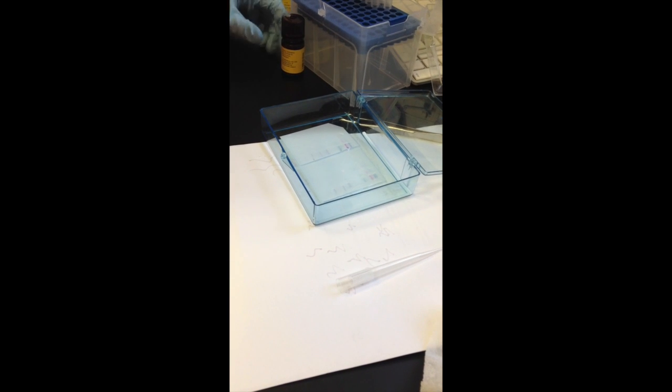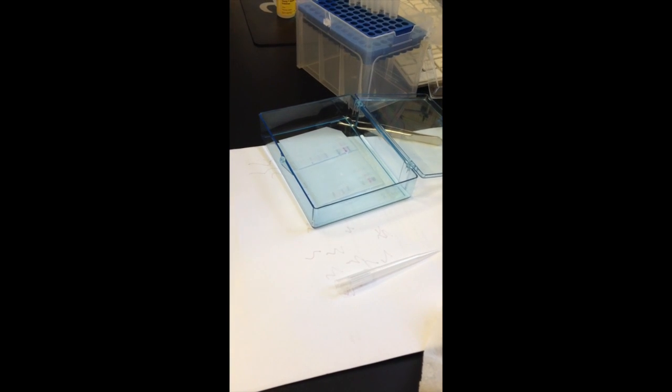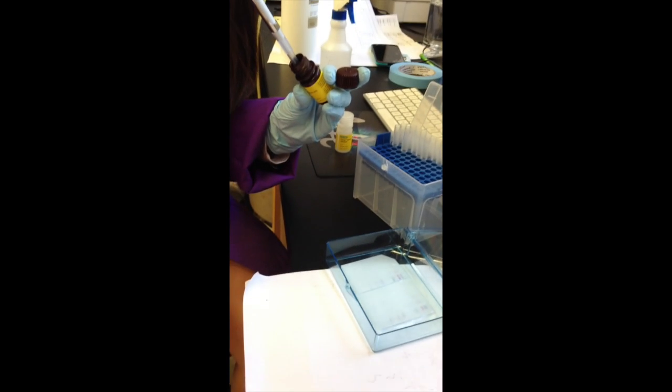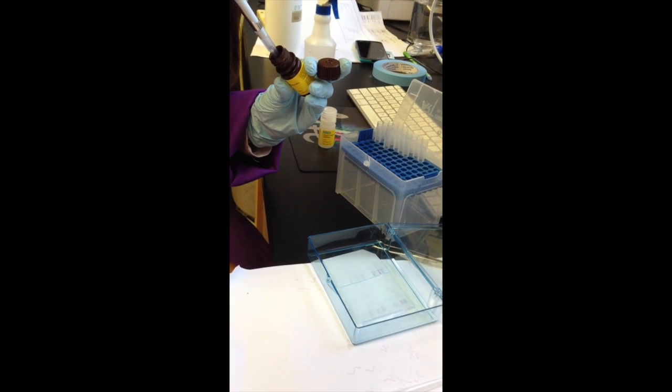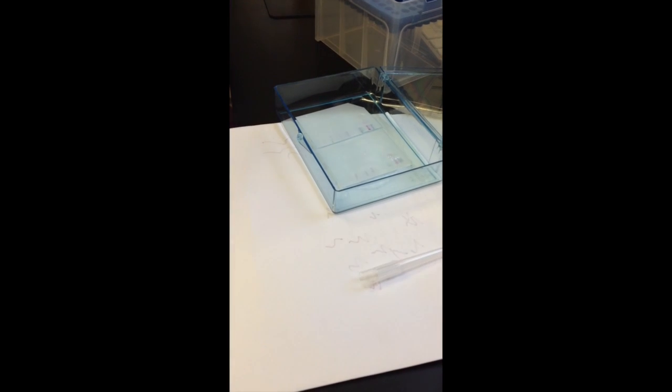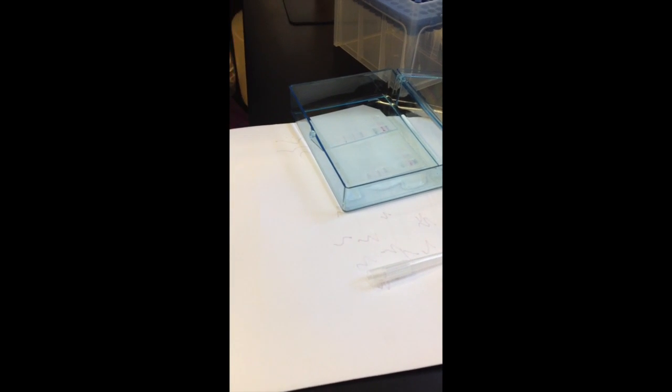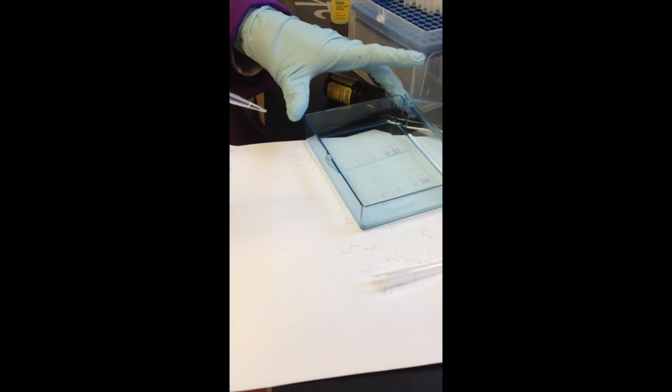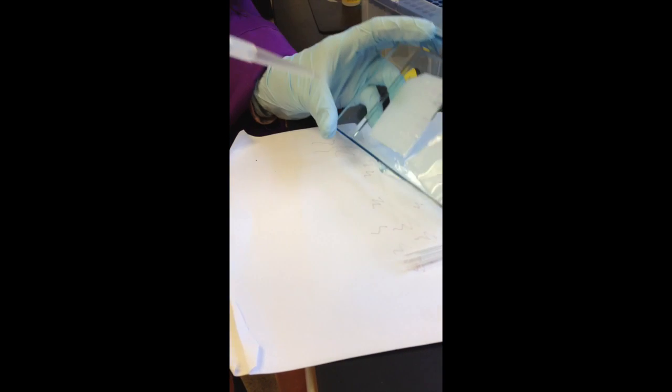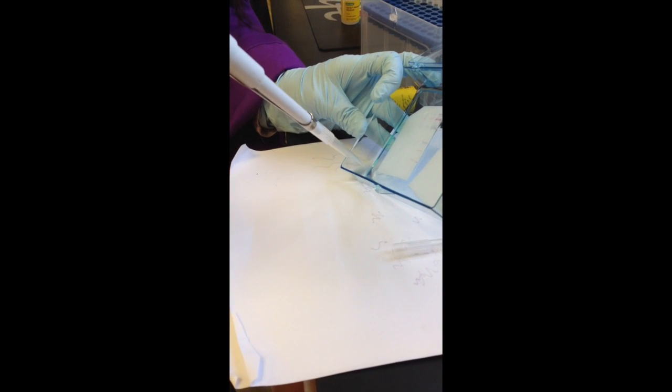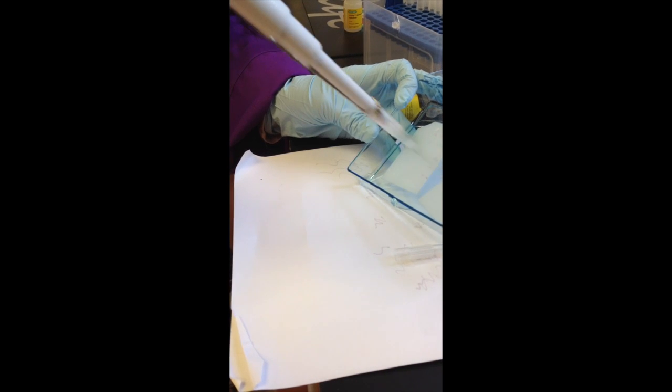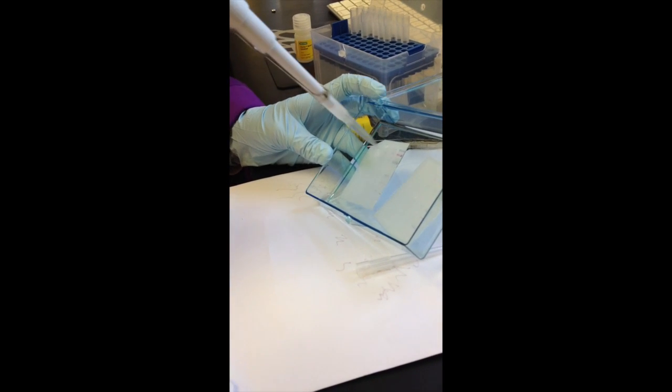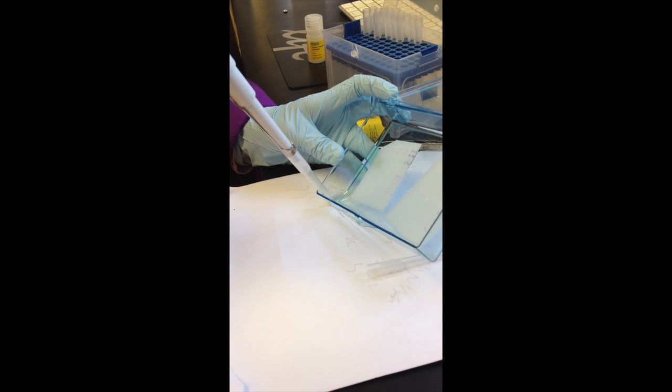And then the other one. Then we will time the substrate incubation for five minutes, and make sure if it doesn't wet the entire blot, you can allow the substrate to go to a corner and pipette it back up, and squirt it back on the blot to make sure it's all wet.